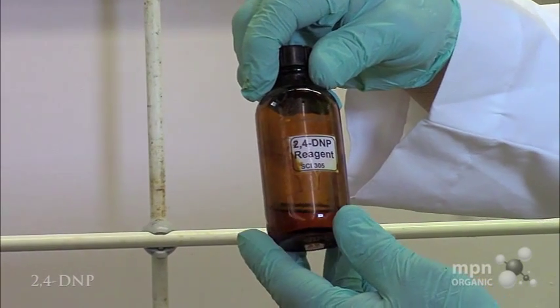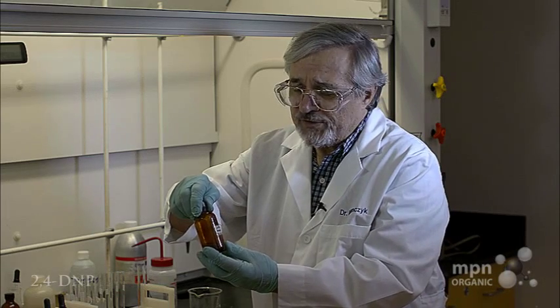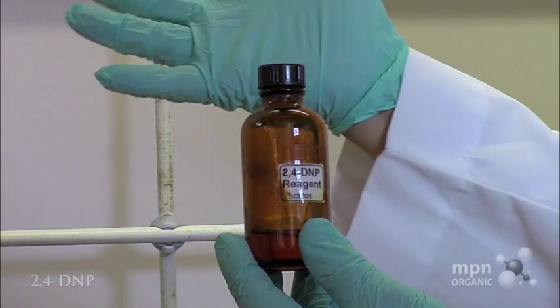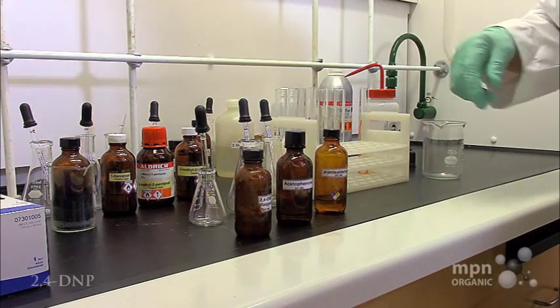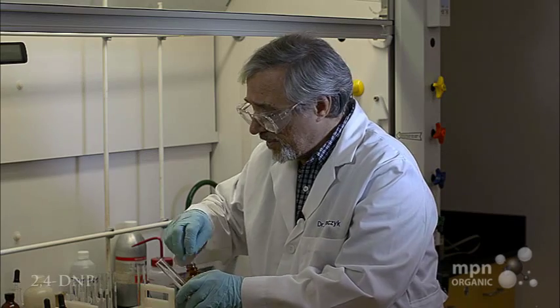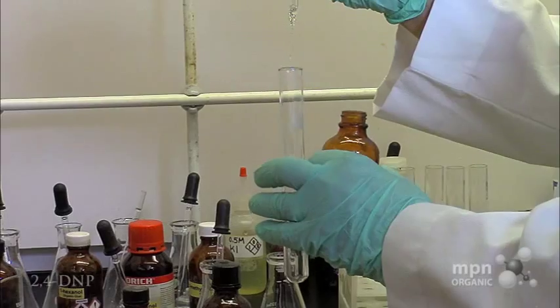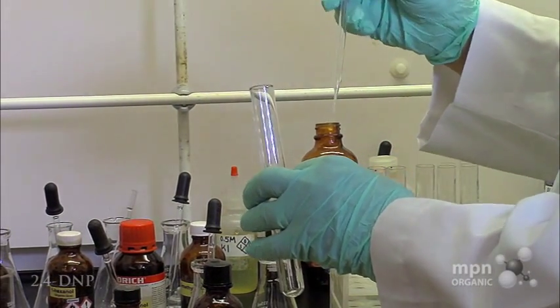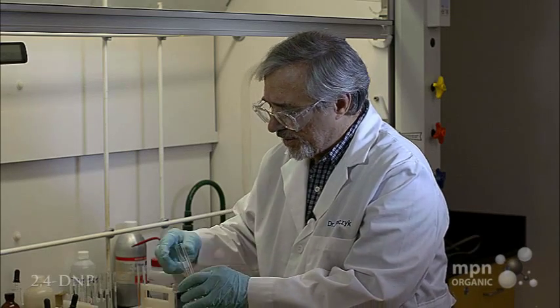Now this is nice benign looking stuff, but the 2,4-dinitrophenylhydrazine has been listed as a carcinogen, and you should always wear gloves when you do this reaction. Let's take a test tube, and we're going to put in some paraanis aldehyde. We just need a few drops of it really. Okay, we've got five drops in there.